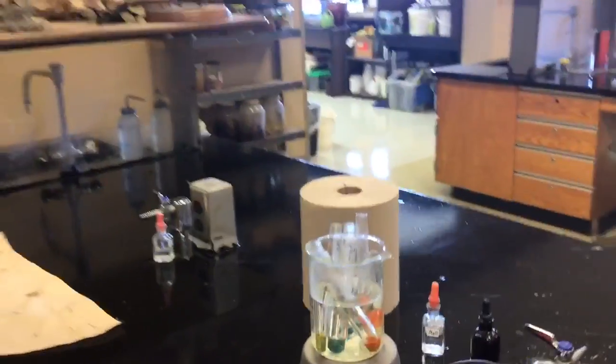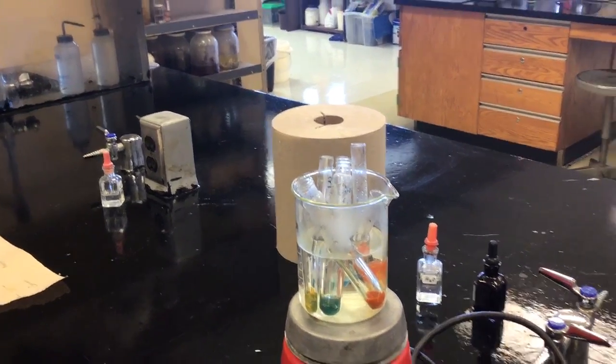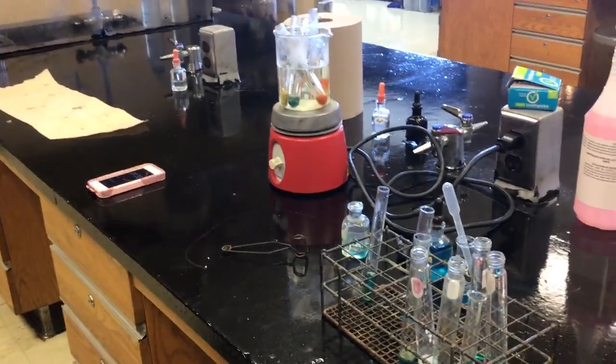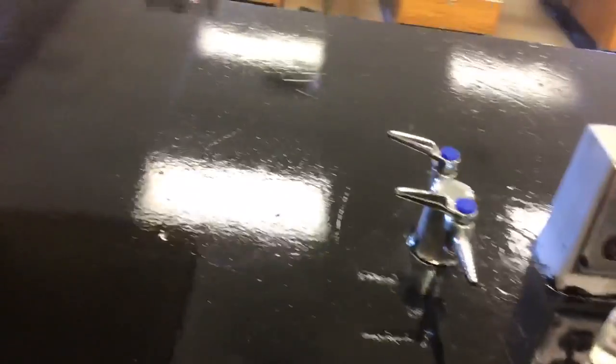We've still got some time to cook here. I found myself a test tube holder so I can take the things out without burning my hands. I did not put the color controls in with the food because I didn't want to lose track of what was what — having two test tubes in there both with carrots was potentially going to be bad. The trick is to make sure you start with a decent wet spot.